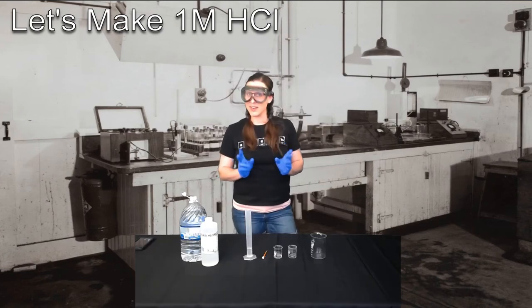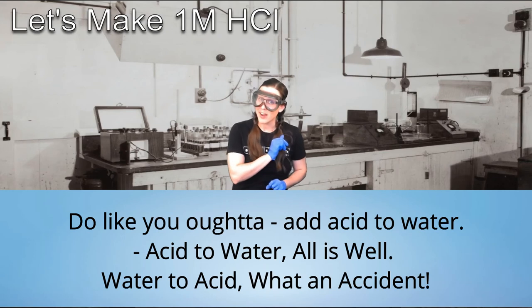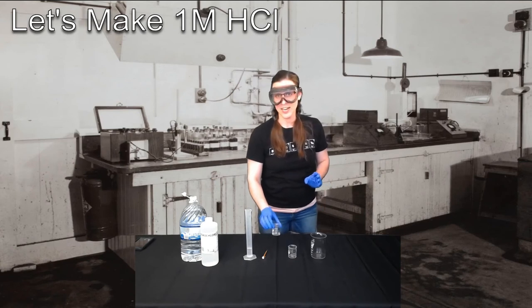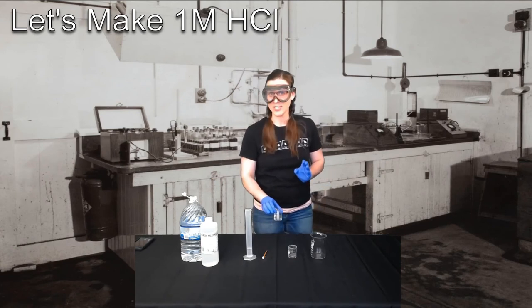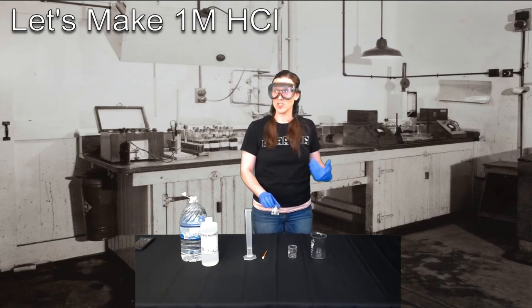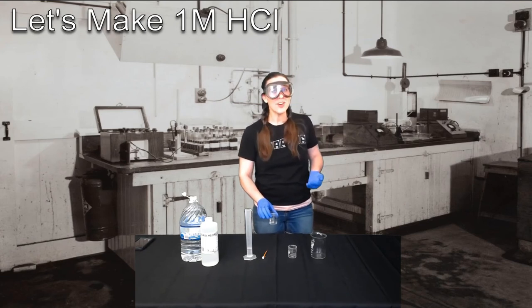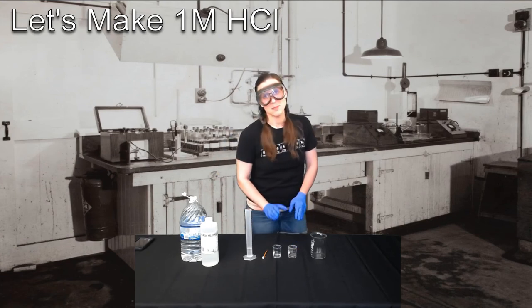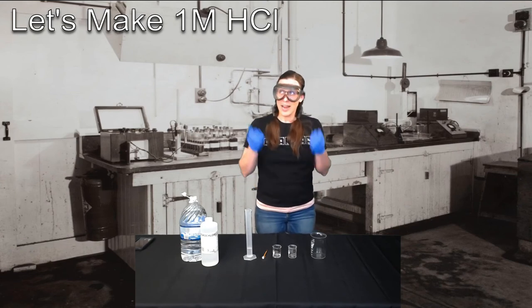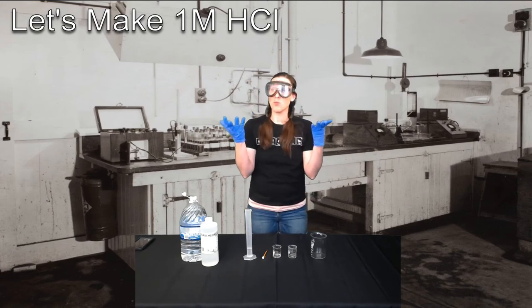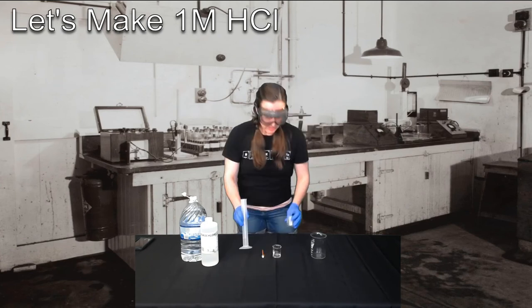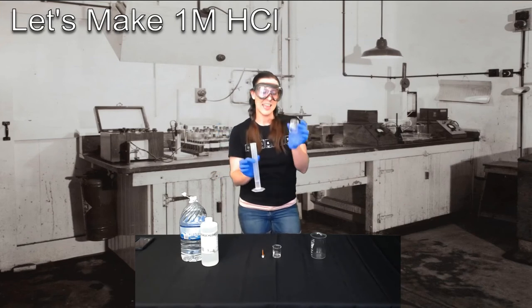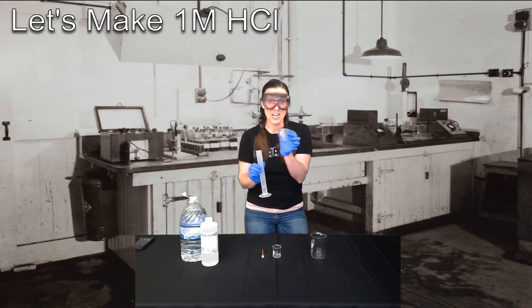In chemistry, we have a little jingle and it goes like this, do as you ought to add acid to water. The reason we do that is because if I was to take this concentrated 10.2 molar HCL and dump it on myself on accident, which happens more often than you'd like to think, it would hurt a lot. It would burn my skin and likely scar me. However, if I add my small amount of acid to water, whatever would accidentally dump on me would be diluted, so it would hurt me less. So in order to do as I ought to add acid to water, I need to put my water in my 1 molar HCL mixing container.